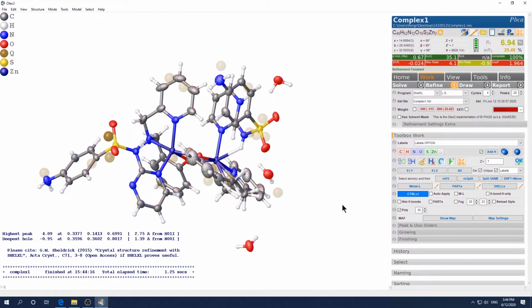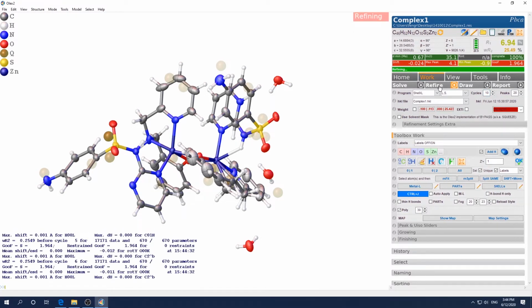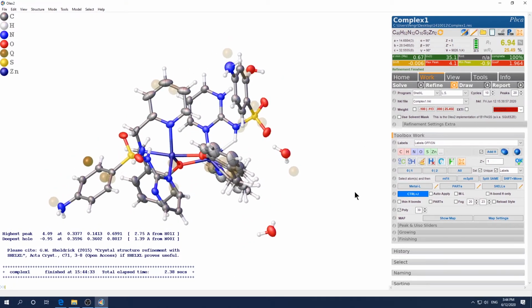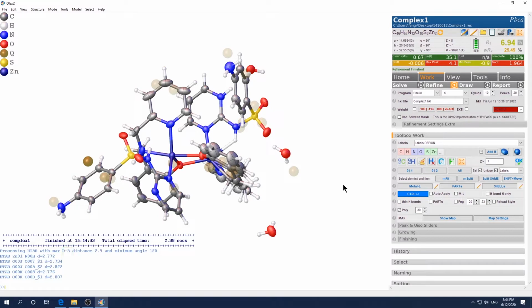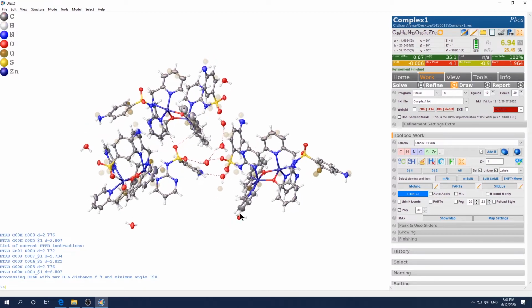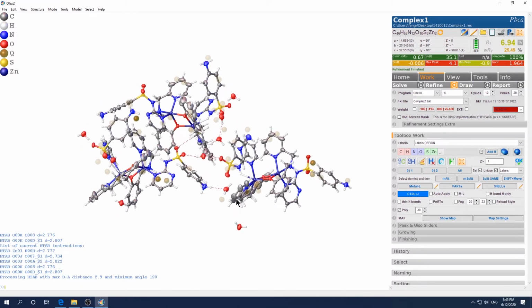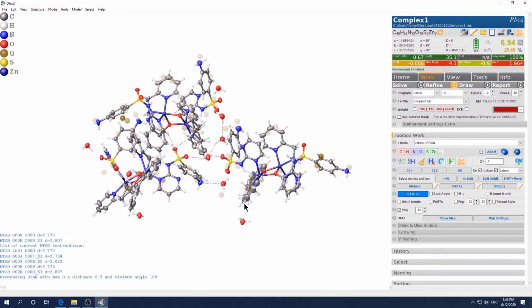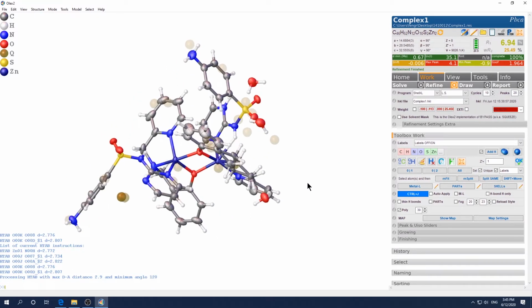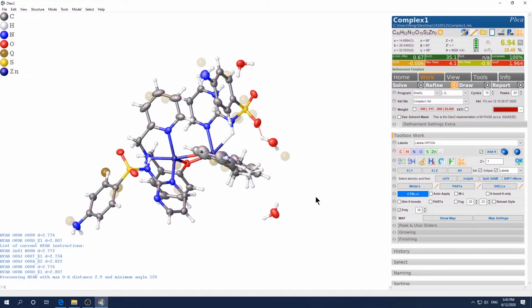So this, let's just increase this to 10. Click one more time. Okay, and we want to see if the hydrogen bonding is making sense. So just type HTAB to bring up the hydrogen bonding. Let's HTAB, dash G. Okay, let's see. Yeah, most of them are making sense. Good, good. Okay, just type fuse to bring back to the asymmetric unit. Okay, let's continue to refine.